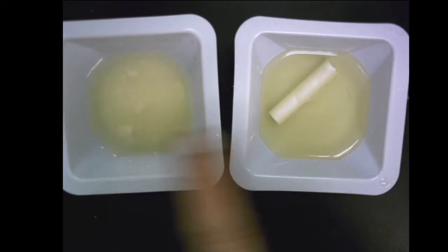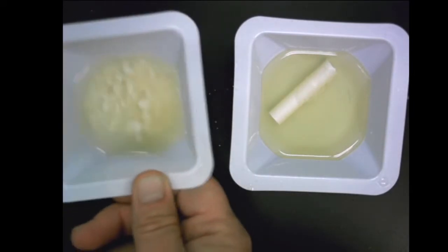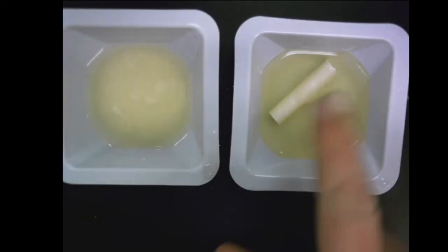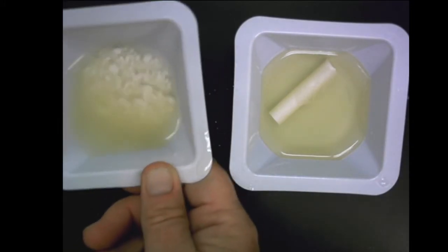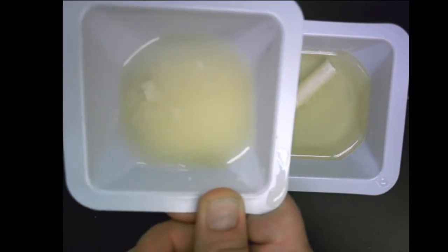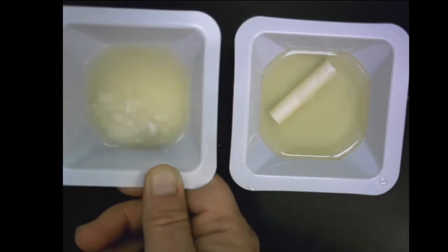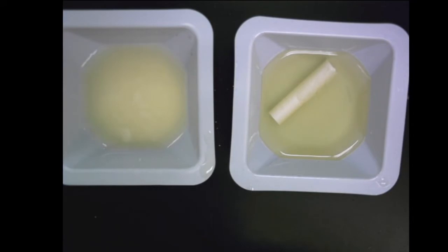Okay, which one do you see? The rate of reaction, where are the bubbles? How many bubbles did we have? Was it higher in the whole or the crushed? Hopefully you said crushed, because I can even see it dissolving all of the little things. You can see it make all those bubbles as I stir it. Mix it a little bit more so they have higher collisions with each other, the atoms. All right, that is your experiment of chalk and vinegar.